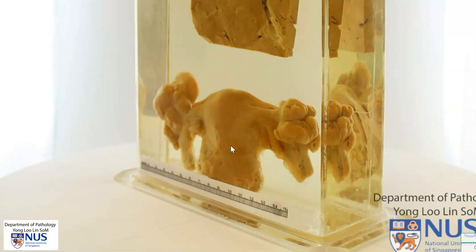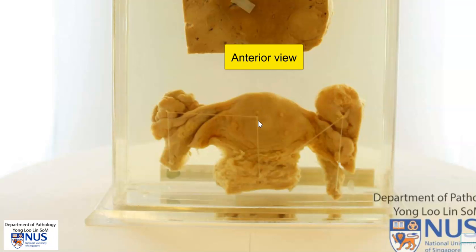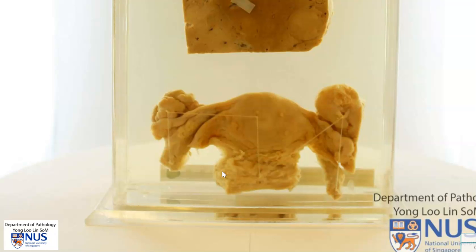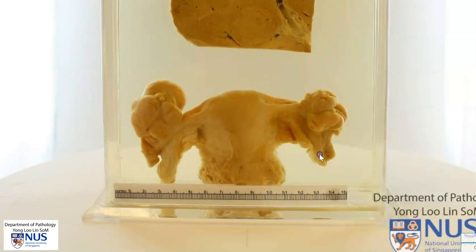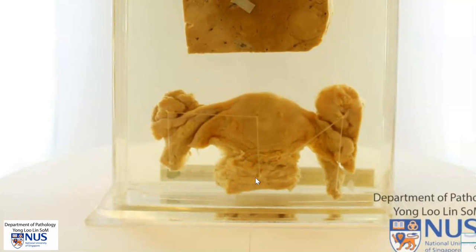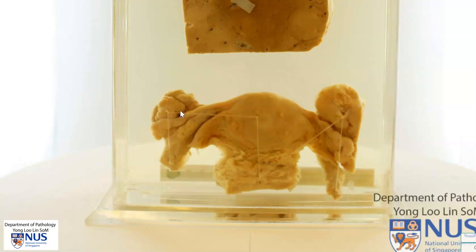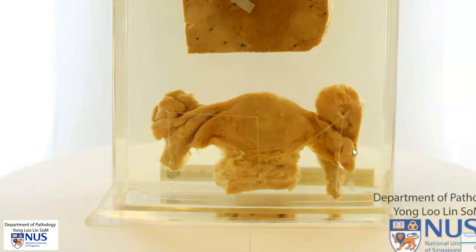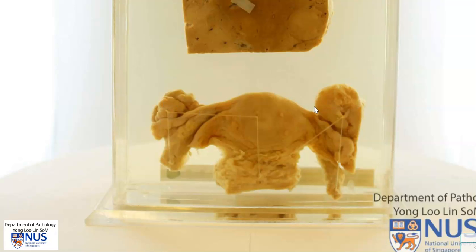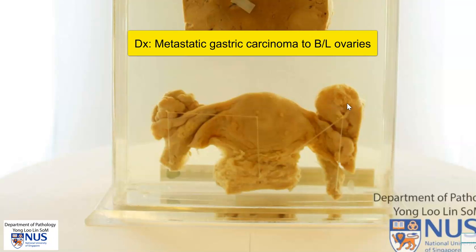I want you to focus on the uterine serosa. As I turn this around, this is the anterior surface of the uterus. We can see that the peritoneal reflection is actually higher up anteriorly compared to posteriorly, and this is because of the presence of the bladder anteriorly. Here is the right fallopian tube and the enlarged right ovary, and this is the left fallopian tube with the enlarged left ovary. What is happening here is also metastatic gastric carcinoma involving bilateral ovaries.